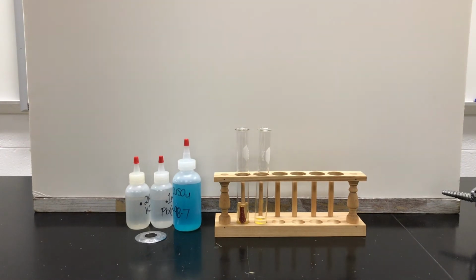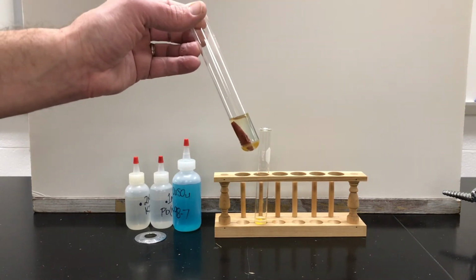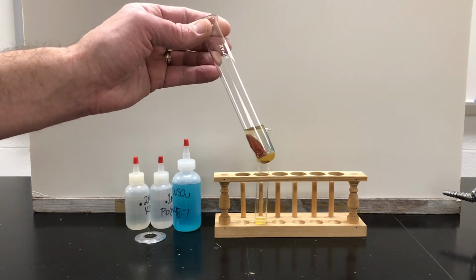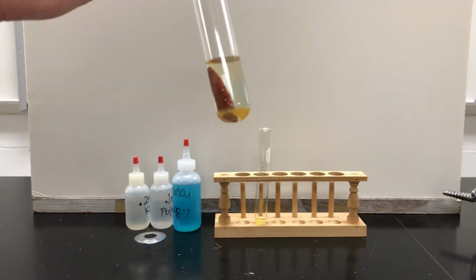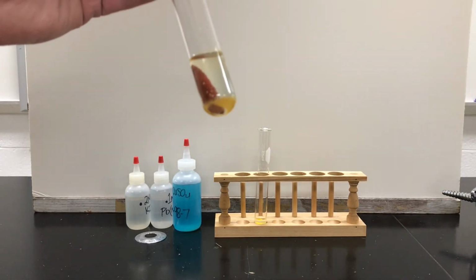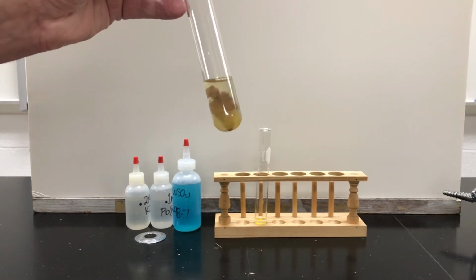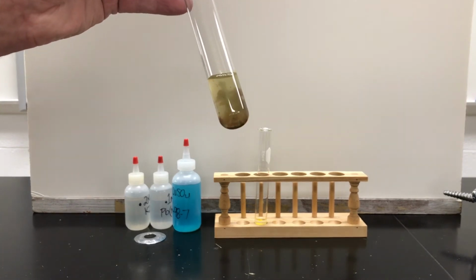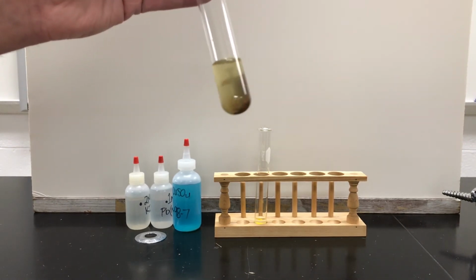So we let the two reactions of the copper sulfate and the iron nail go overnight, and we can see that the blue from the solution is gone. We can see that the nail is completely covered in a material, and if we give it a shake, we can get the bulk of that material off and make it go to the bottom of the test tube. It got a little cloudy, but again, if we let that sit, it'll clear up over time.